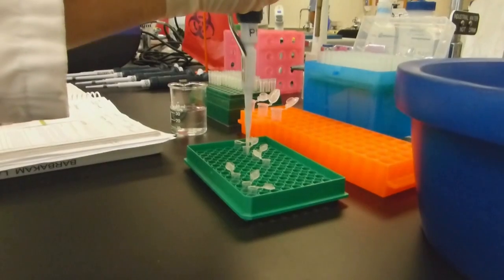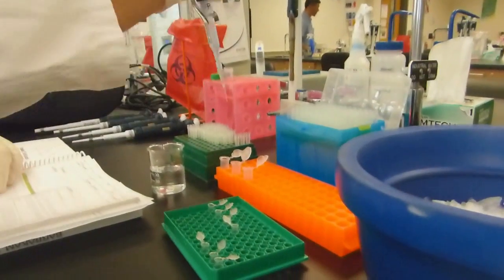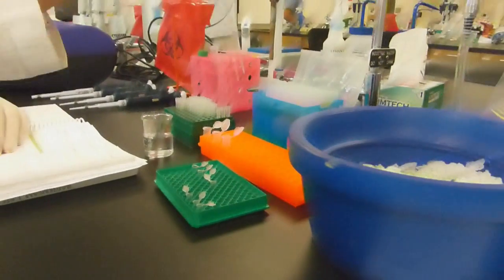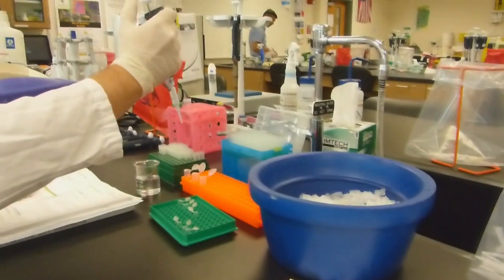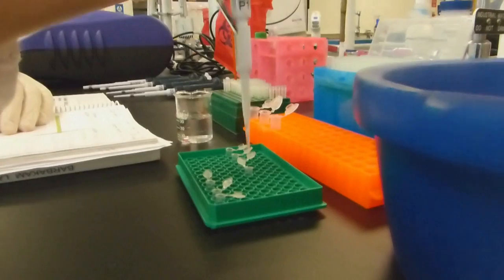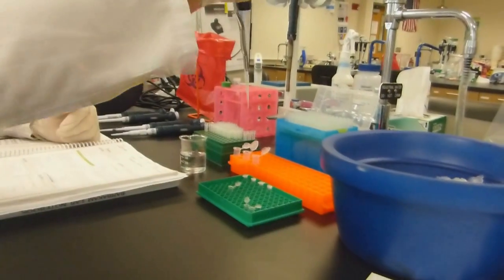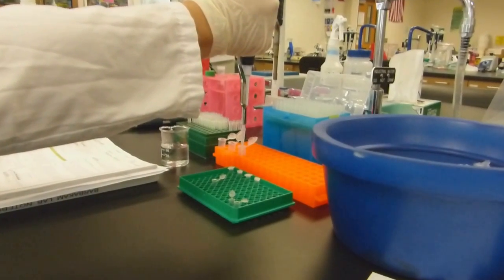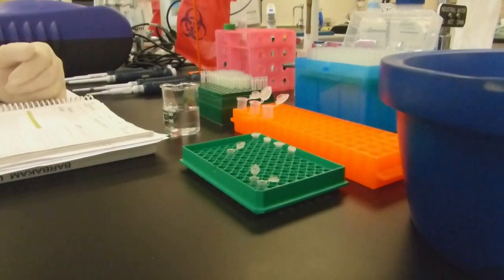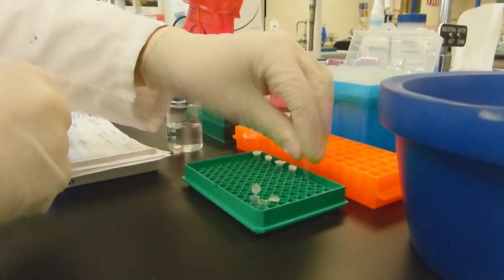The last step is to add 5 microliters of your sample to the tube. Make sure to note which sample tube is paired with the reaction tube as you add the sample in case you need to identify the sample at a later time. And again, it is critical that you change your tip between each sample that you load. You have all your samples prepped, but you still need to make a tube with your positive control. The positive control will show that the PCR reaction worked and will produce a 270 base pair band that will be visible on our final gel.